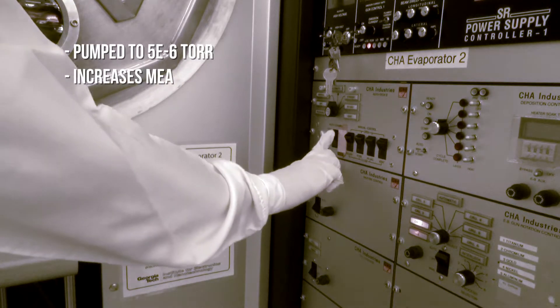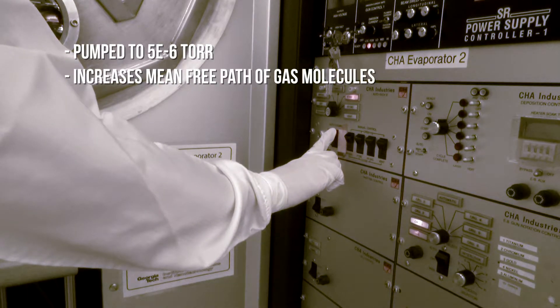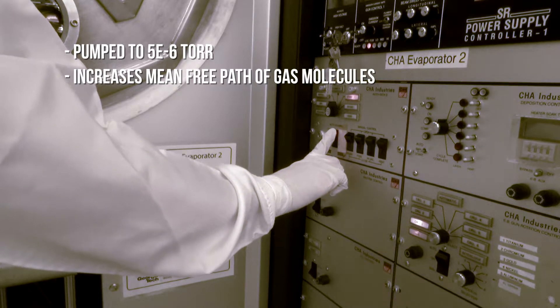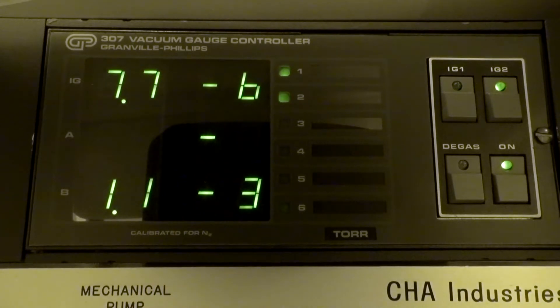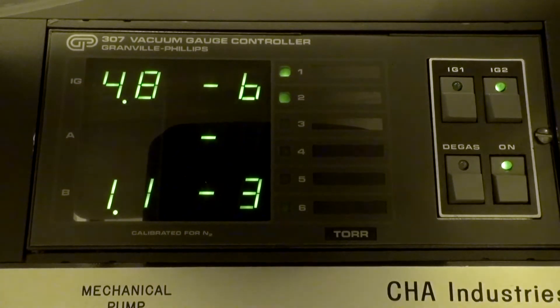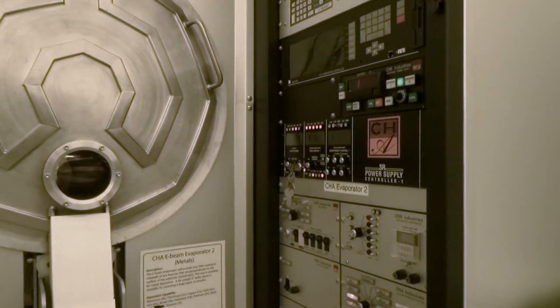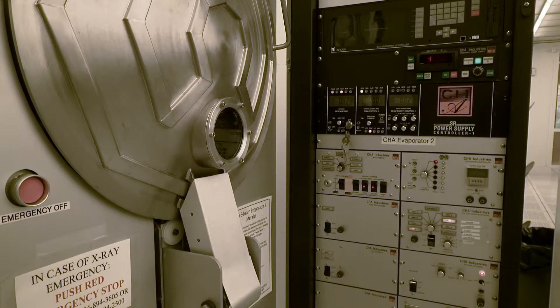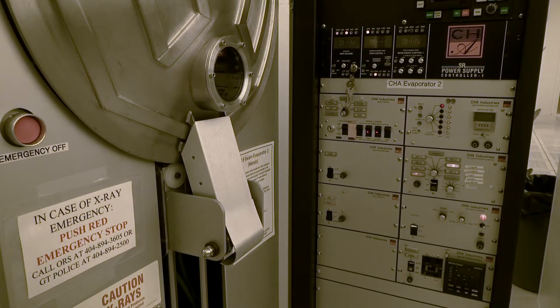In a typical process, the chamber is pumped down to a pressure of 5×10⁻⁶ Torr to increase the mean free path. The mean free path of a gas molecule is the average distance the molecule travels before it collides with another. This prevents air molecules from interrupting metal atoms as they travel from the evaporation source to the substrate. Typical deposition rates range from 1 to 3 angstroms per second.